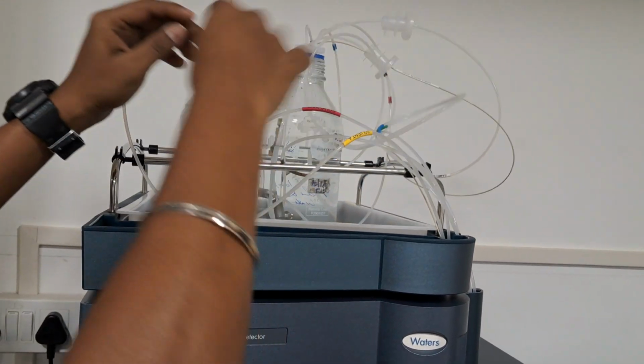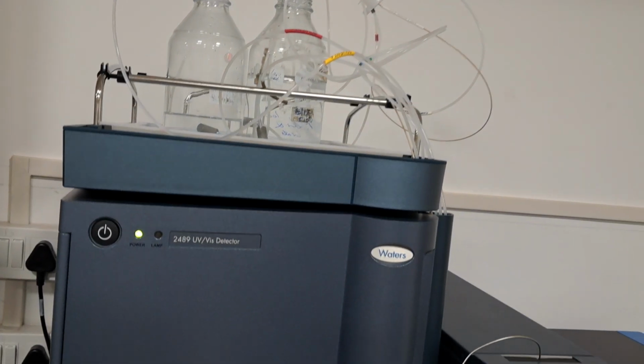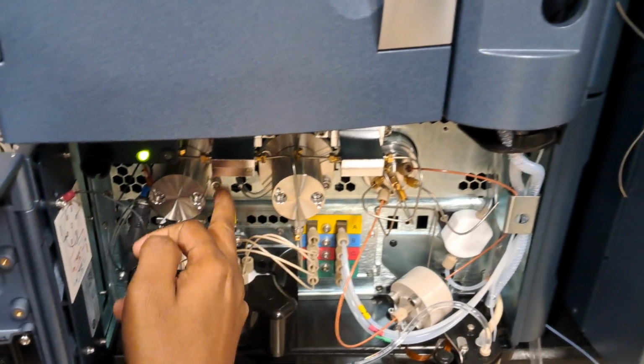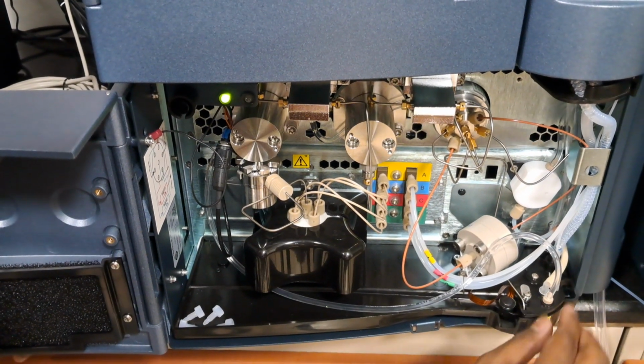It also should be dipped in any of the solvent, or if you are using the flushing solvent as water, it should be dipped in. And it comes here. The seal wash pump takes the flow from the pumping, and it goes inside the pump and it washes the seals. This is the line that has been routed and it is coming out of here actually. You can just see the flow will be coming.